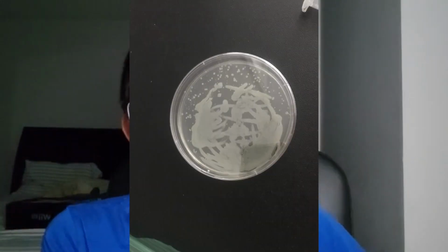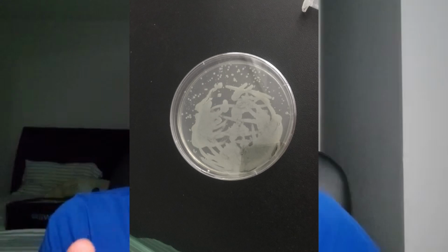If the E. coli grew on your strep plate, it means that the experiment works. After a couple of days, this is how my experiment looked like. Through this video, you've learned the basics of how CRISPR works through a hands-on activity.